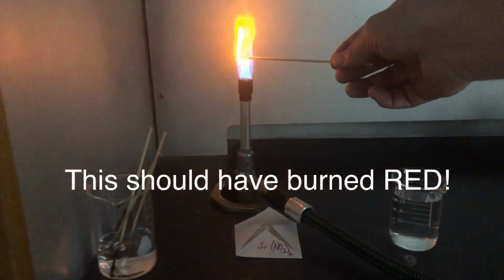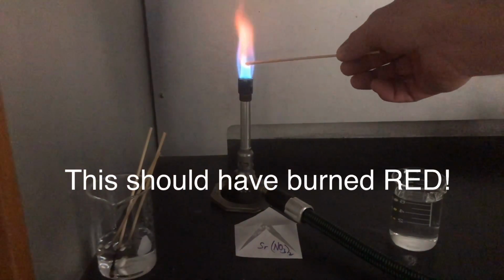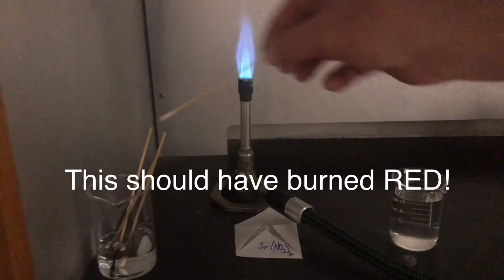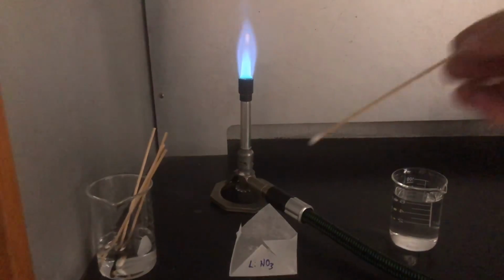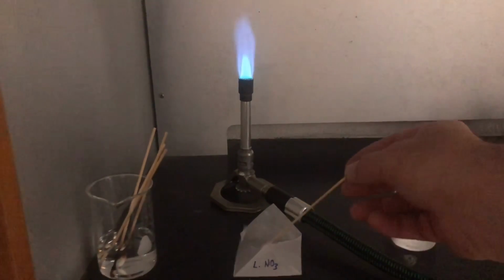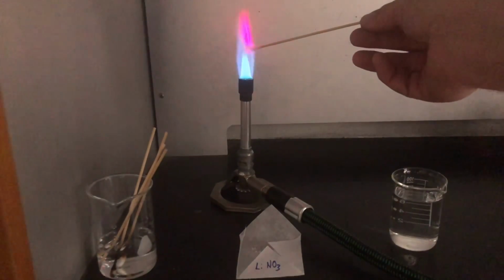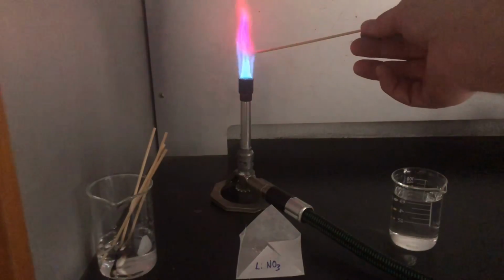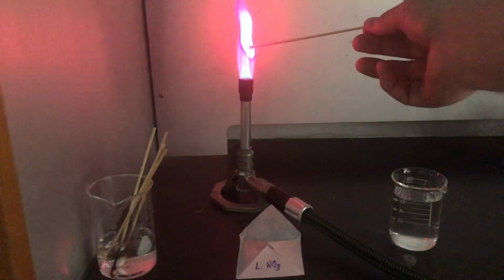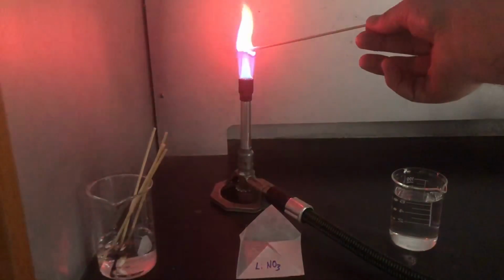A little brighter orange. Burns a lot more vigorously. Lithium nitrate. Ooh, that's a nice, pretty red. Almost a fuchsia, with a tiny bit of orange, but mostly a nice red color.